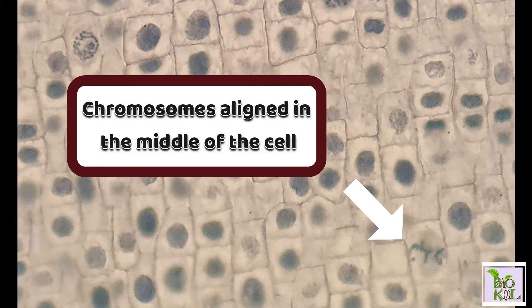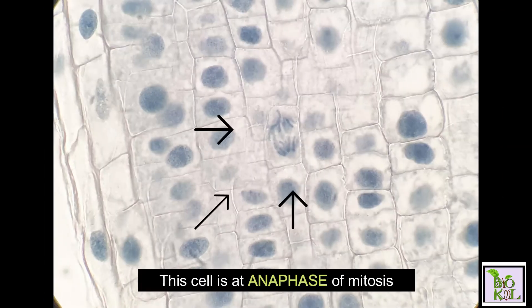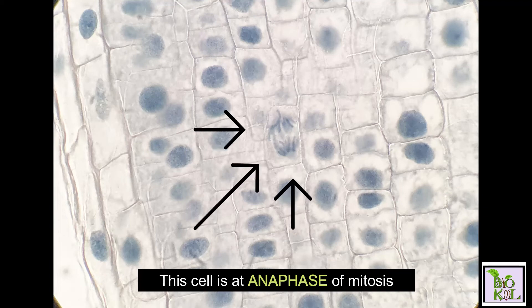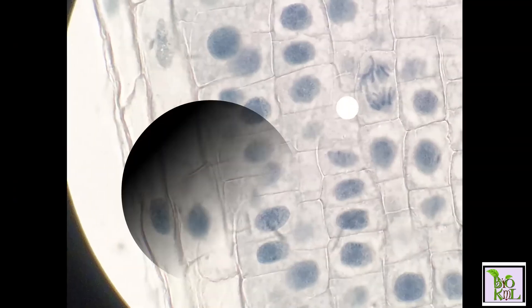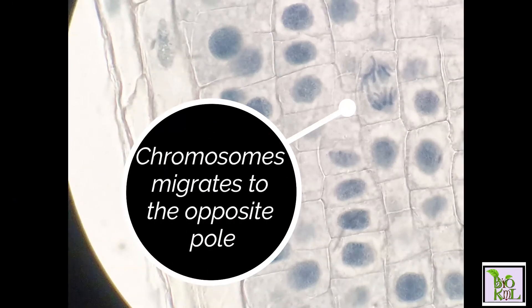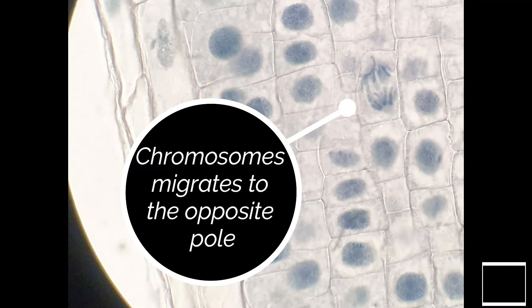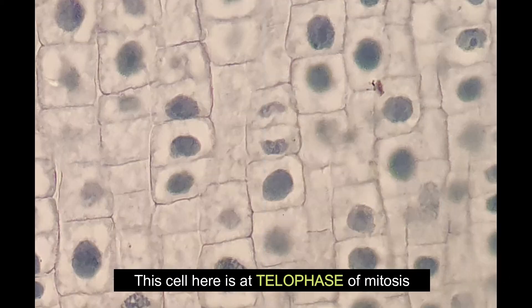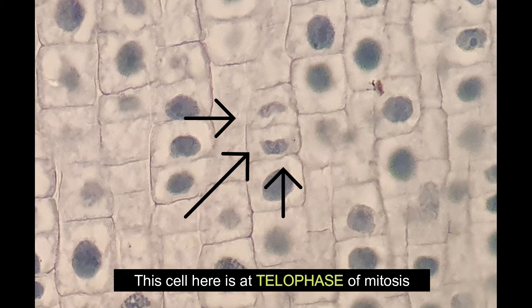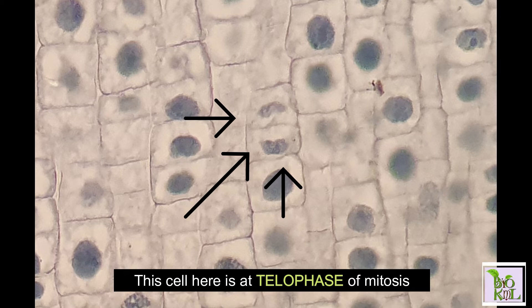This cell is at anaphase of mitosis. At anaphase, chromosomes migrate to the opposite pole. This cell here is at telophase of mitosis.